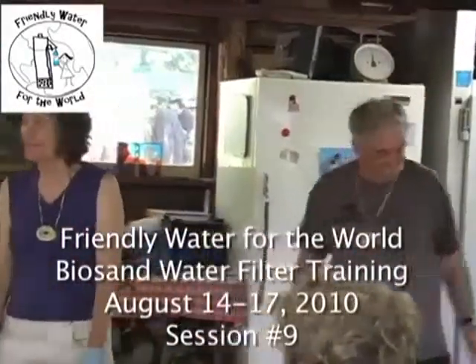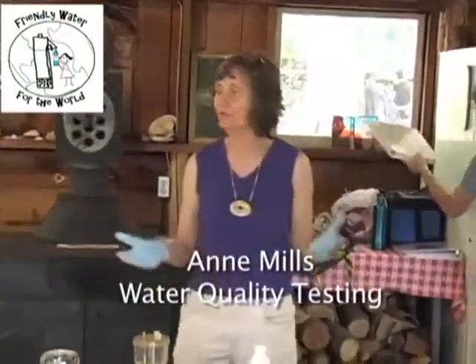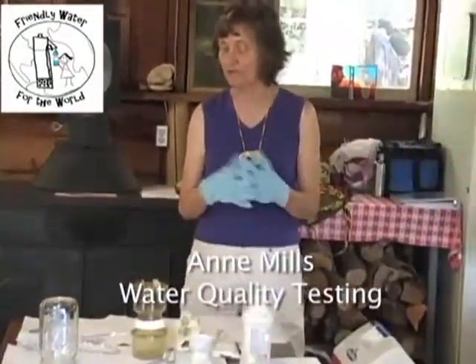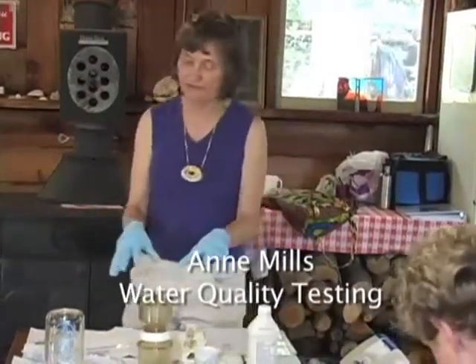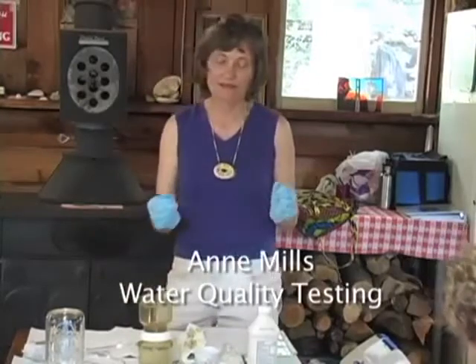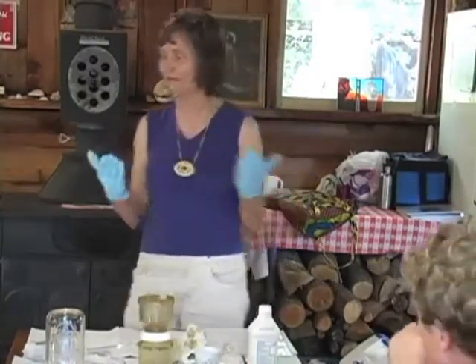Thank you. Okay. Well, Ginny and I are going to kind of tag team on this, but we want to show you one way that you can test for bacteria. This particular method can be done in the field if you're very careful with your sterile technique. It means you don't have to be in a lab.